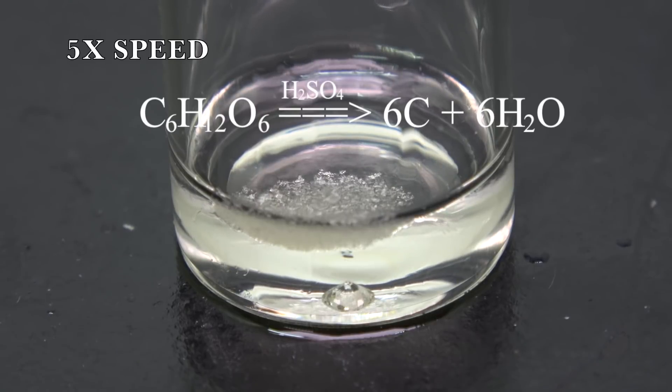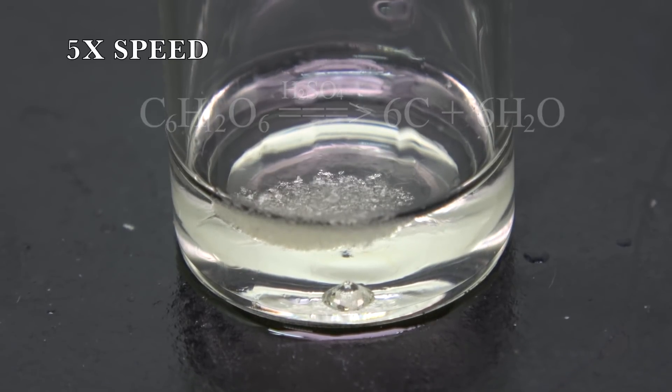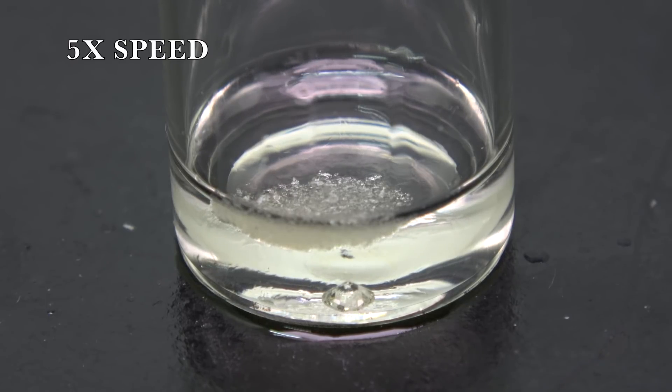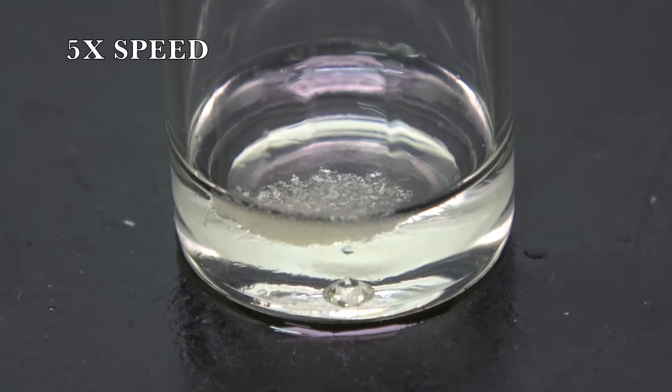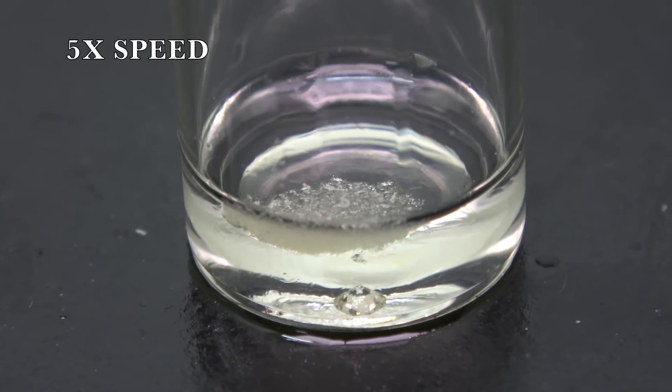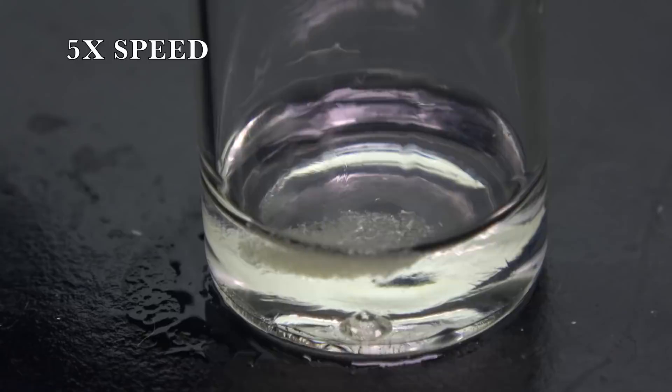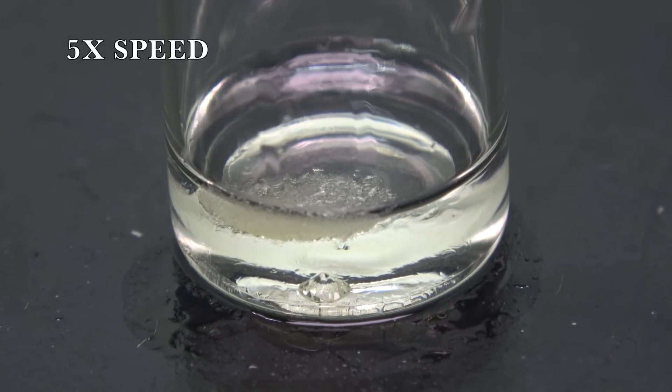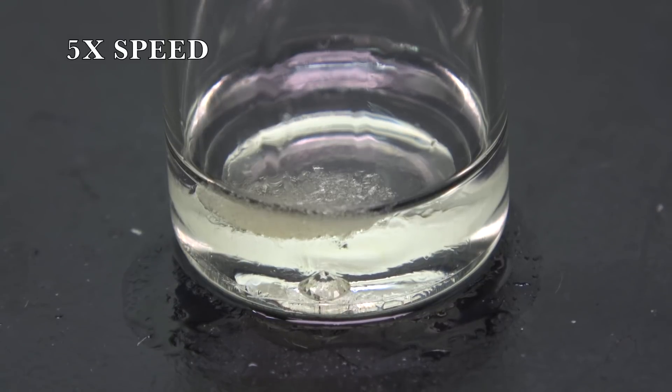Okay, this might not be obvious, but if you watch carefully, you can see there are light distortions. This phenomenon is caused by mixing two liquids with different refractive index. In this case, it's obviously the mixing between sulfuric acid and water. Since I was doing this in winter, it might take a while for the glucose to have any significant changes.